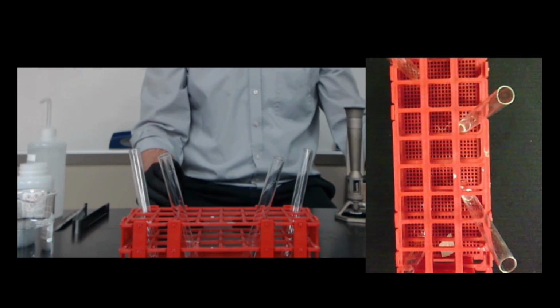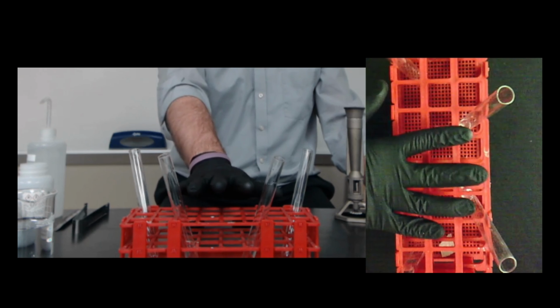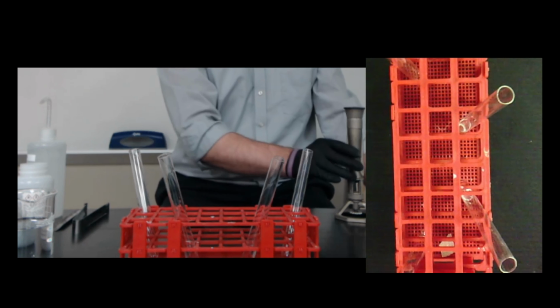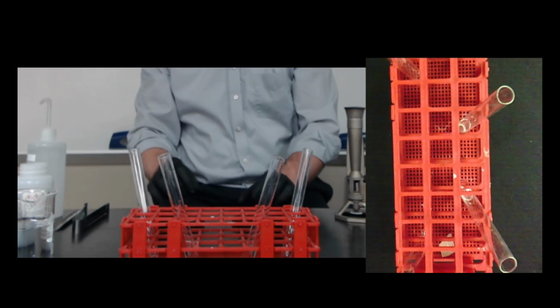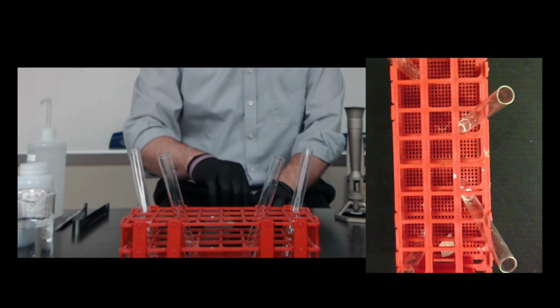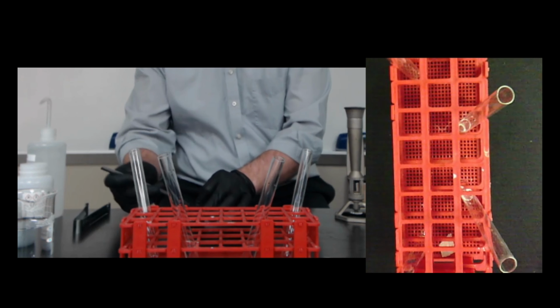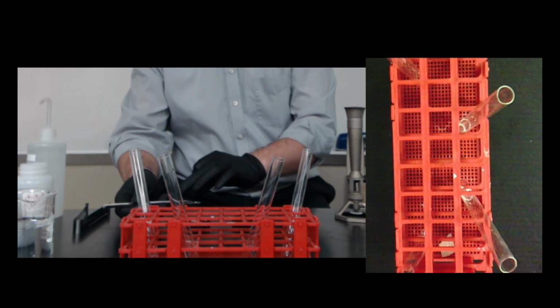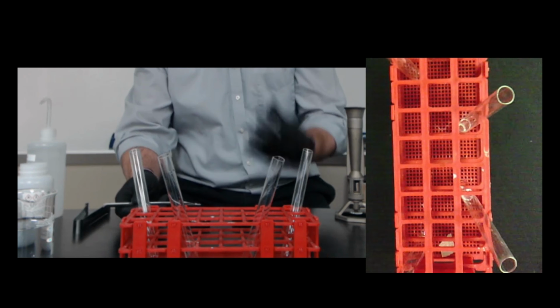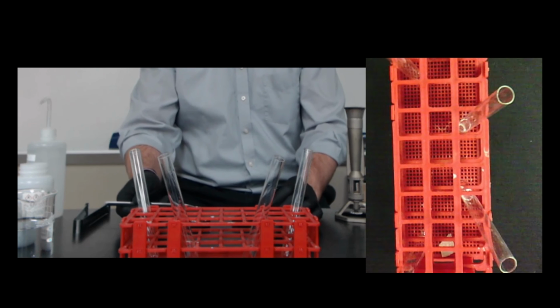I am going to put the metals into our test tubes, and then I'm going to light my burner and do my flame test. I'm going to try to put the same amount of calcium and magnesium into our test tubes, because I'm looking to see which one reacts faster, which has better reactivity.